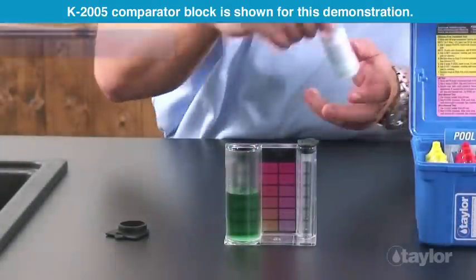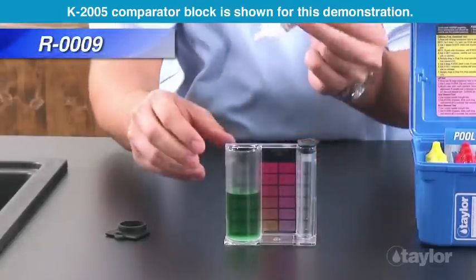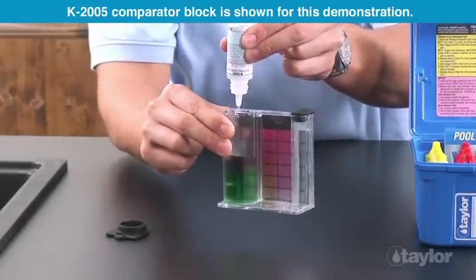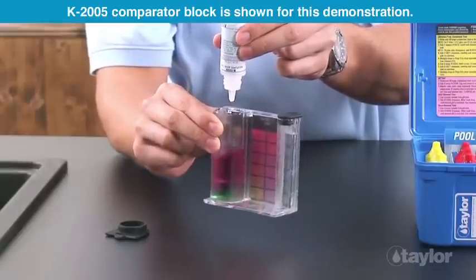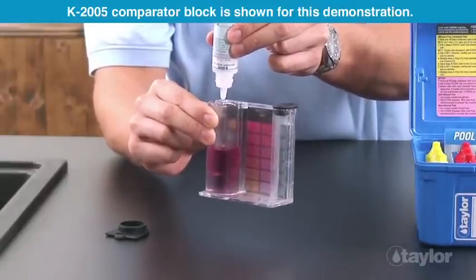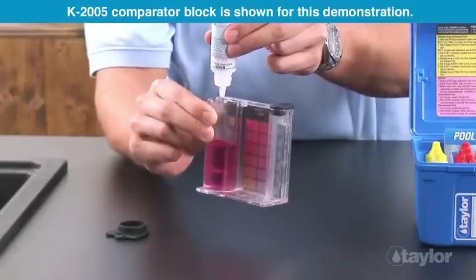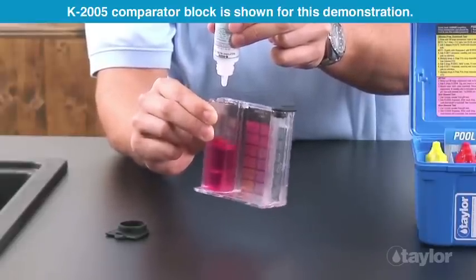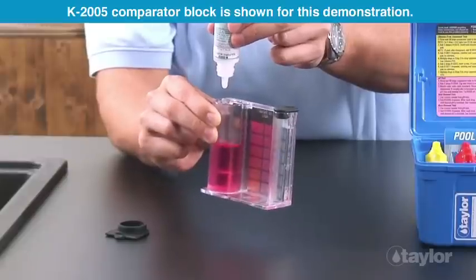Add Reagent 9 dropwise. After each drop, count and swirl to mix until the color changes from green to red. Add one more drop of titrant after the endpoint to be certain the color change is permanent. If the color remains unchanged, do not count this drop.